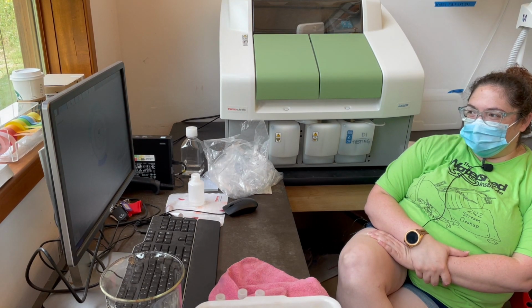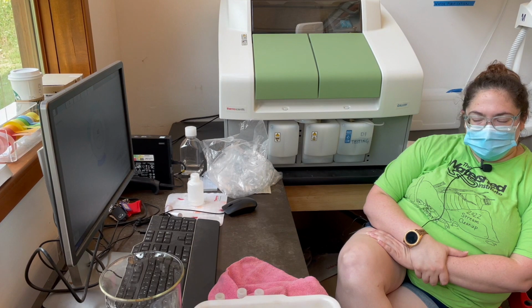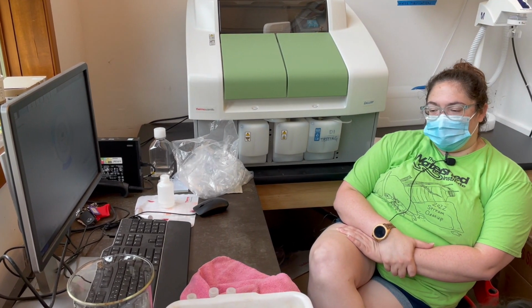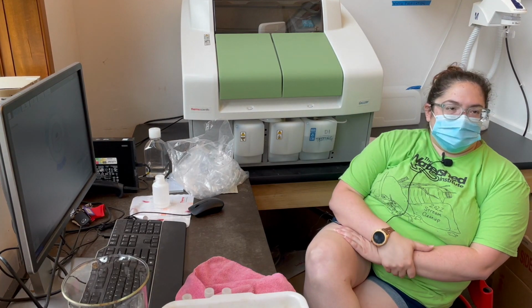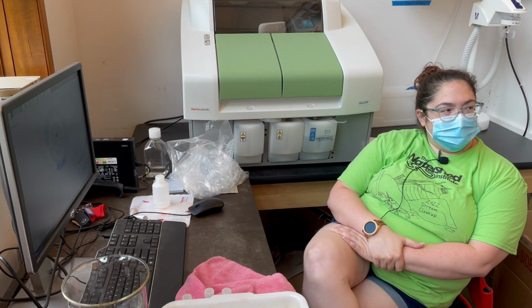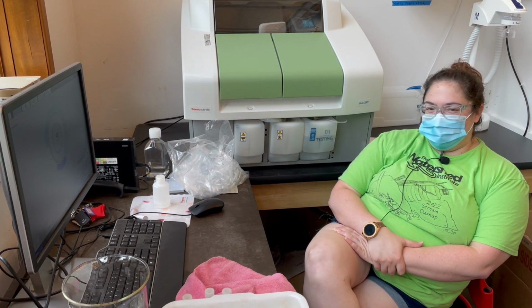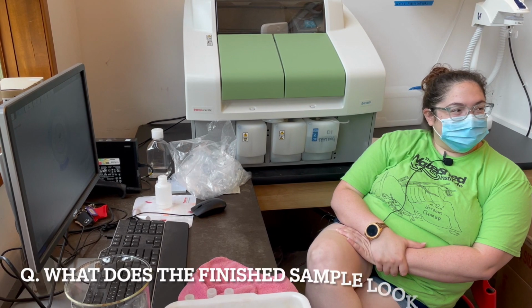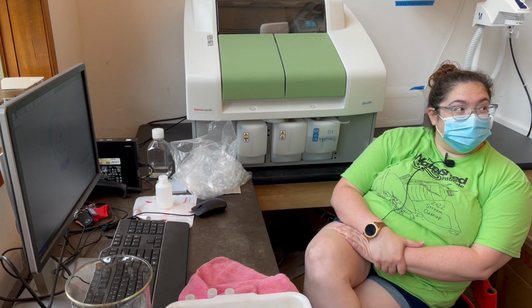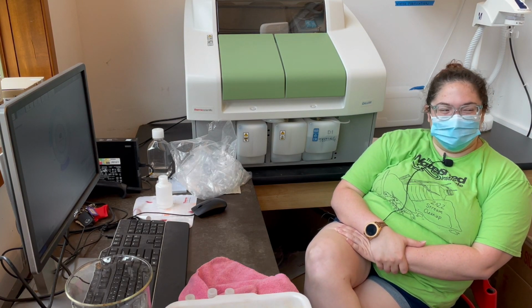Yep, so it'll go through and run each of 5 tests, I want to say, on all 6 of those samples. And then while it's doing that, I will fill up some more samples and add them, and the time will get longer, and I'll just sit here. Okay, so what does the finished sample look like? Just a bunch of numbers. Oh. A spreadsheet. It's not very exciting.